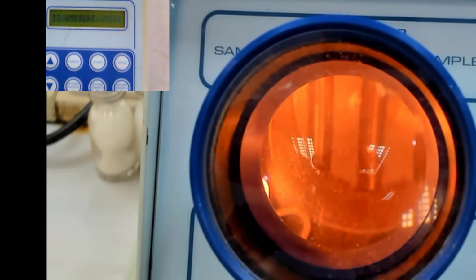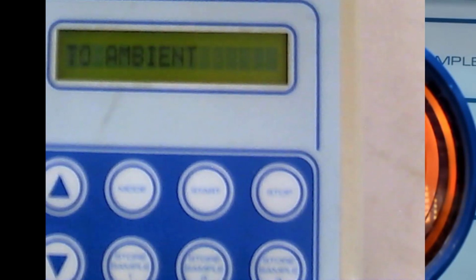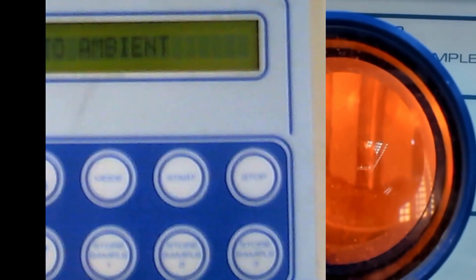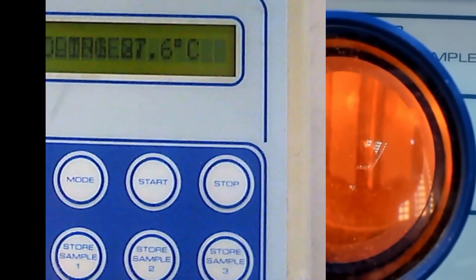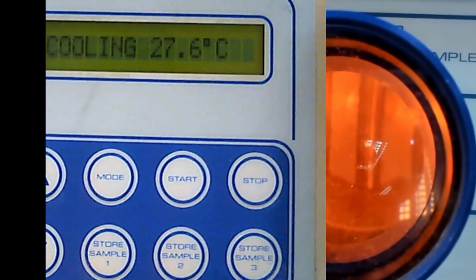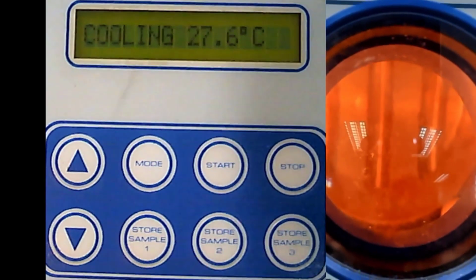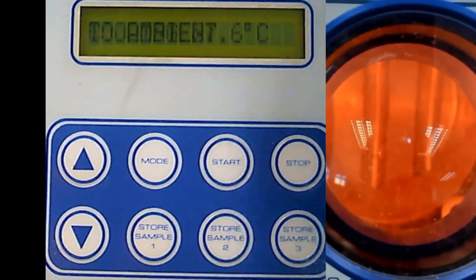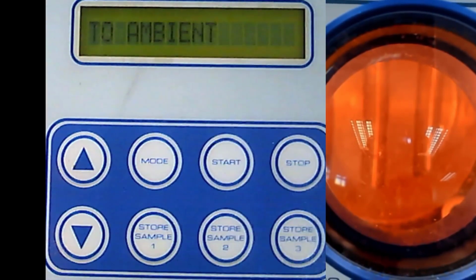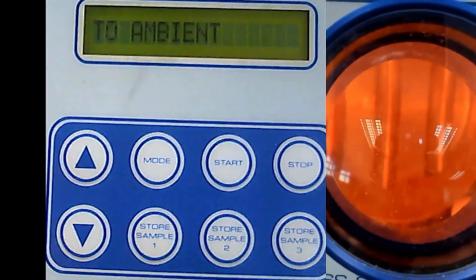I just bring it down, and then I just want that thing only. Let me adjust the thing. Okay, I think you can see this control panel, and also let me check this. Sorry, we need a little bit of time.